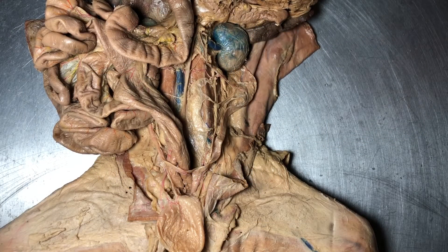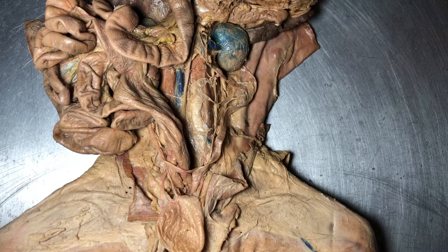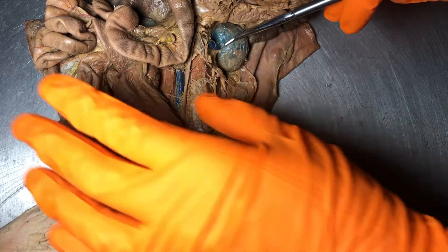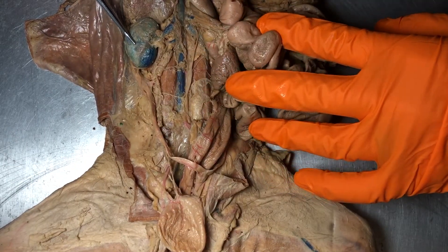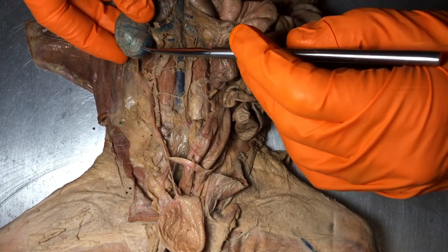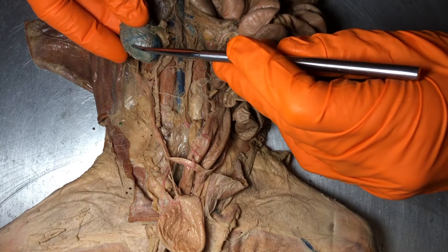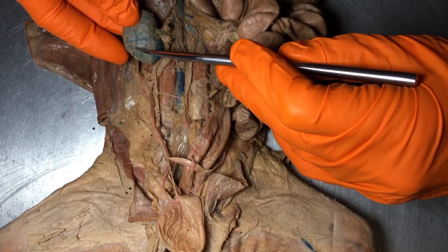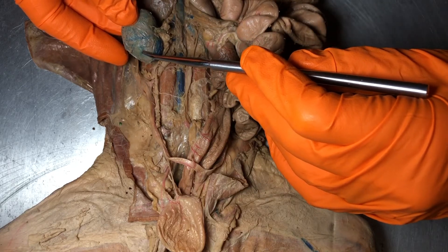Let's take a look at some of the basic urinary structures on our cat specimen. This right here is going to be our left kidney and this one is the right kidney. On the surface of each kidney is this tissue layer — it kind of looks like a wet paper towel, that's how I like to describe it, and it moves around a little bit. That is actually going to be the renal capsule, so that covers each kidney.